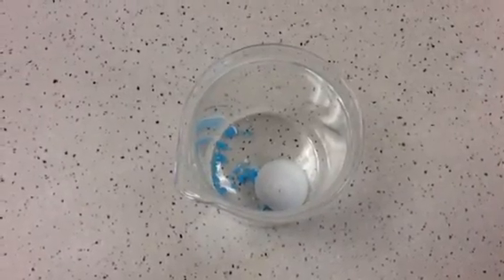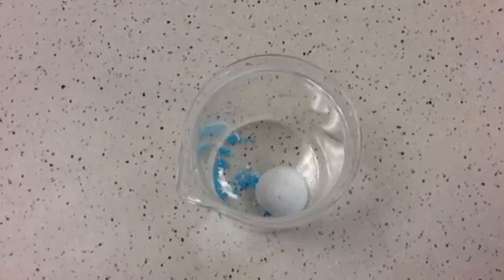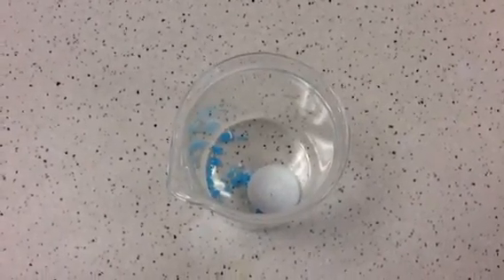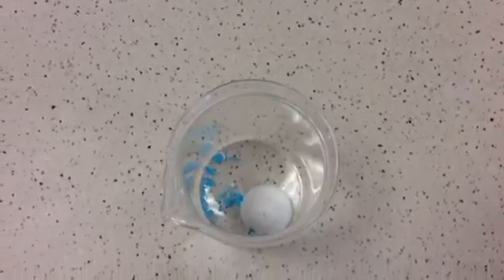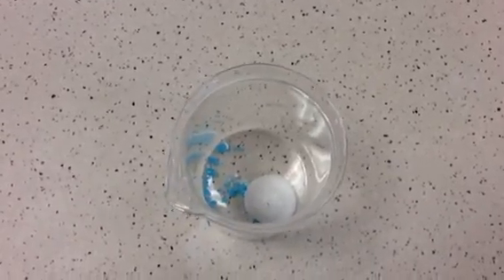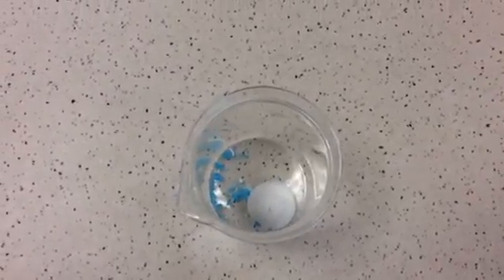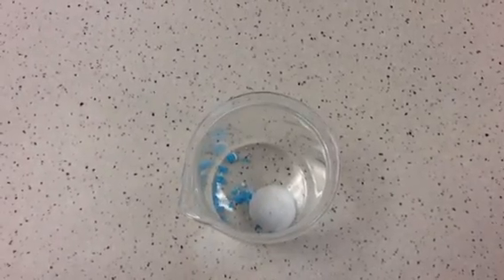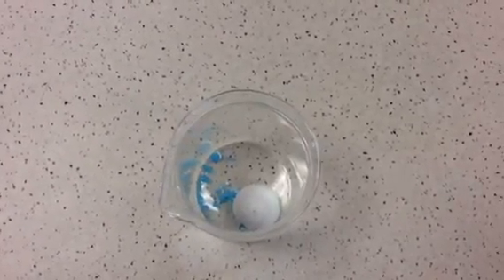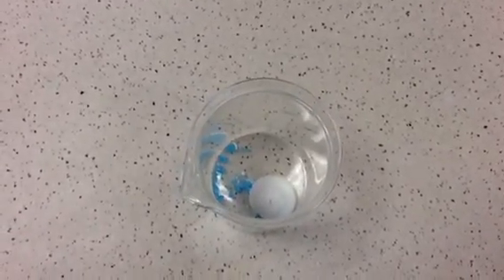Okay, hopefully we can all agree that it's changed. So at the start of the reaction it was blue because it was hydrated copper sulfate. Think about what hydrated means. When you're hydrated, what have you got? And now it's called anhydrous copper sulfate. So anhydrous is a little bit like if you say that you're dehydrated. So if you say you're dehydrated, think about what you might be lacking at that point. So anhydrous copper sulfate is lacking the same thing.